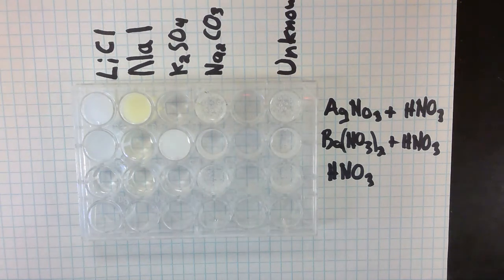If you're doing the lab in class, you might have a different unknown. It might be one of these other ones. It might be something different. So you have to look at the different tests and say, which one is most like your unknown?